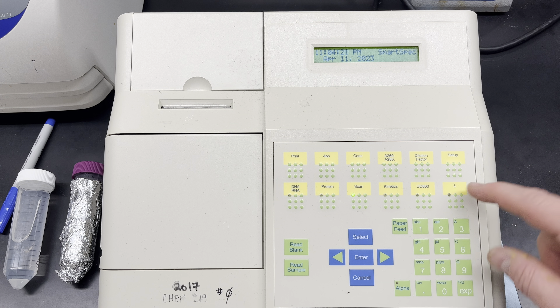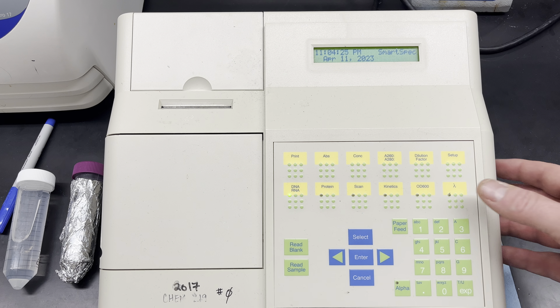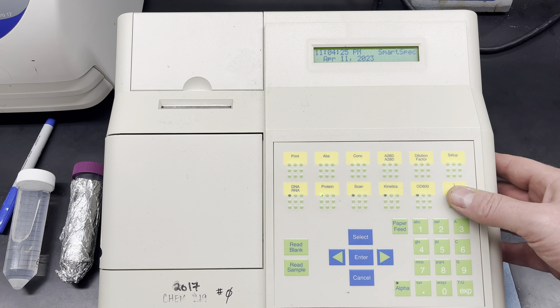What I'm going to do is press this lambda symbol, because that will allow me to designate which wavelength I want to read. I'm only going to be reading one wavelength, so where it says 'enter number of wavelengths to read,' it defaults to one so I'll just press enter. It now asks for the actual wavelength, which is 340 nanometers, and once I've selected that I'll press enter.